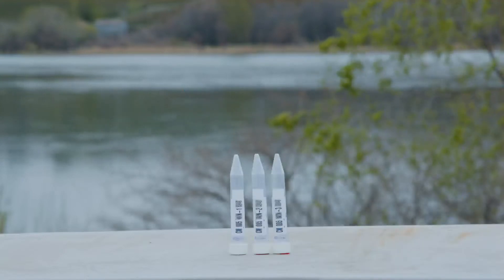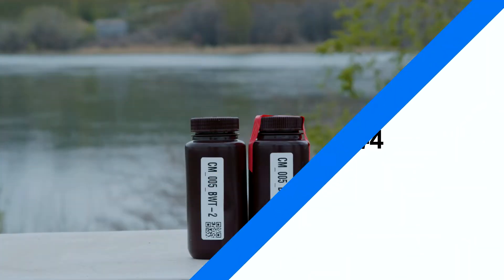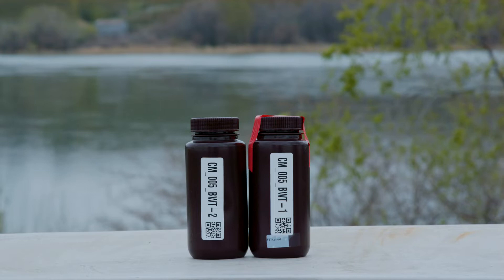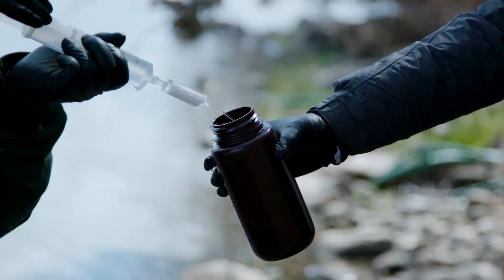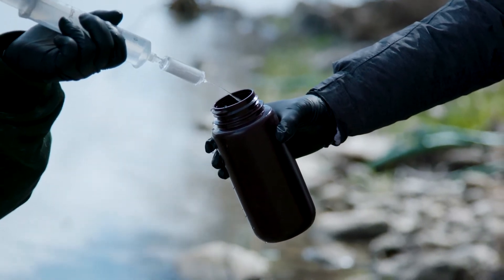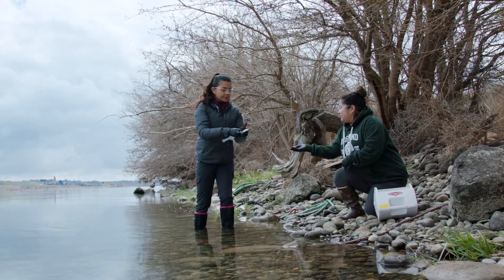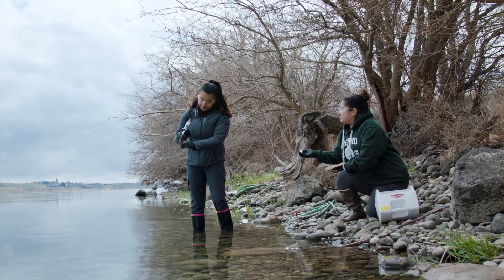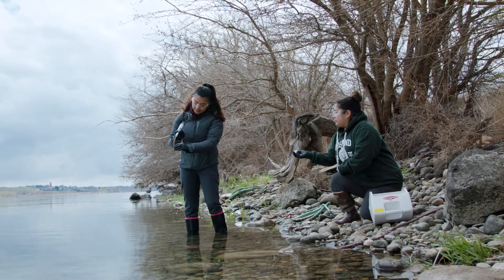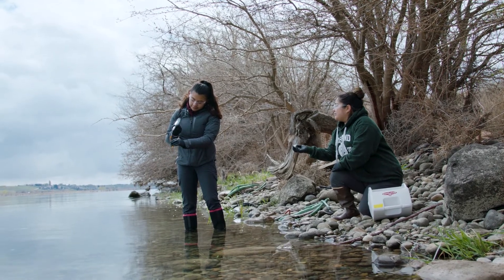Repeat the same process for the opaque brown plastic bottle labeled as BWT and labeled as filtered. Fill the bottle to the neck — you will need to fill the syringe multiple times. At some point during filtering, your pre-labeled filter will clog. In a very turbid system it may happen when you are still filling the small vials; in a less turbid system, it may be when you are filling the large brown bottle. When your filter clogs, pause your current sampling step and preserve the filter.